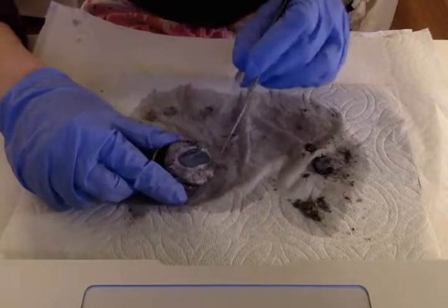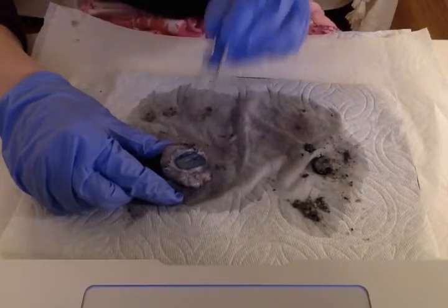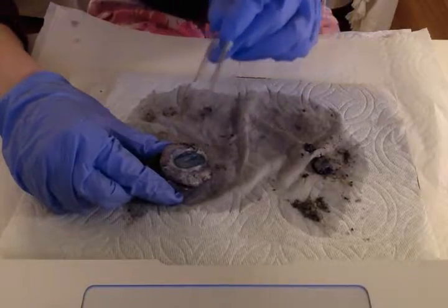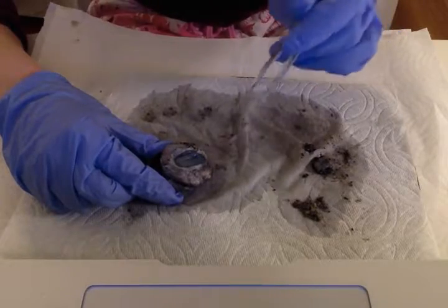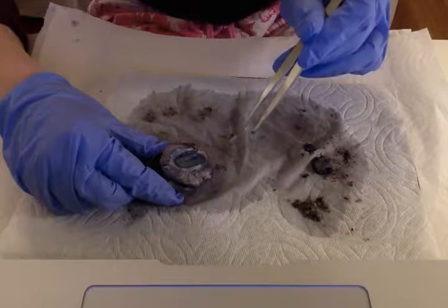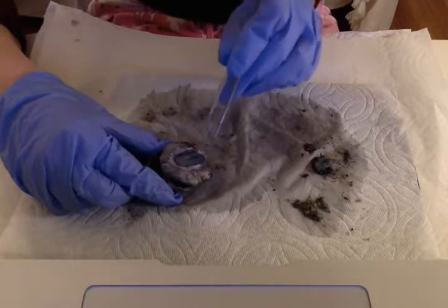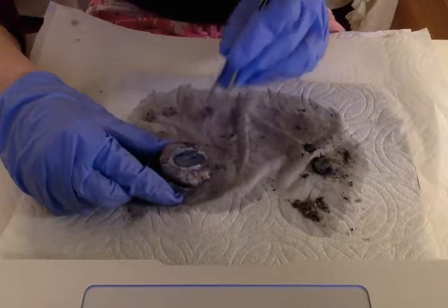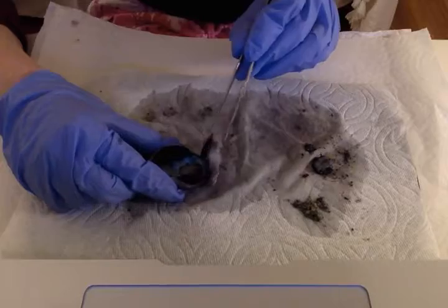Okay, so now the cornea. The cornea is right here, and it's the portion of the sclera that covers the anterior chamber in front of the lens. When light enters the eye, it's first refracted, or bent, through the cornea, which is really interesting. In this dissection, it's this cloudy blue-looking structure, but I believe that when the cow was alive, it was clear.